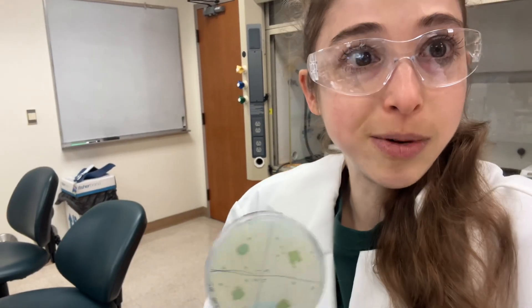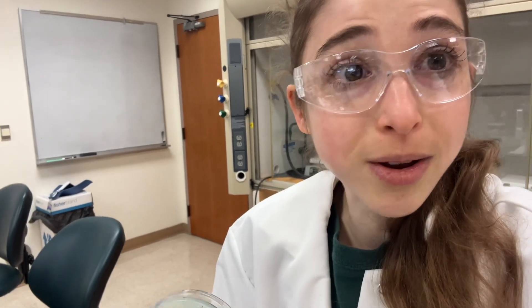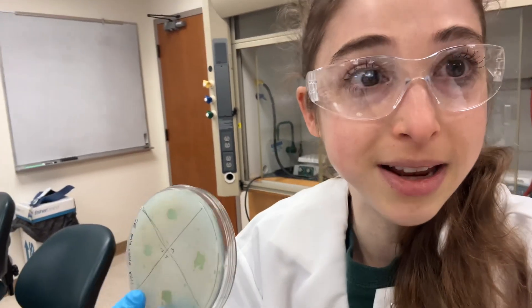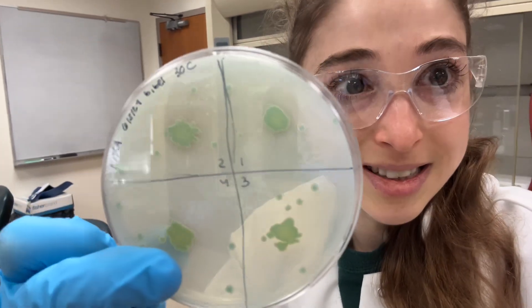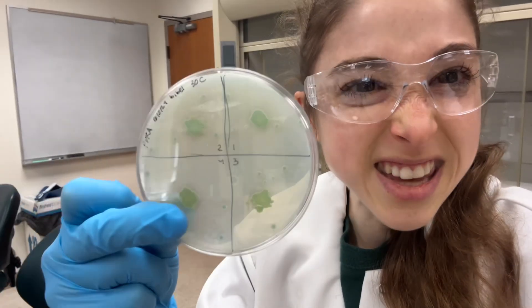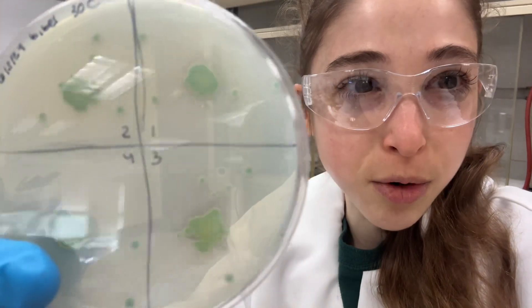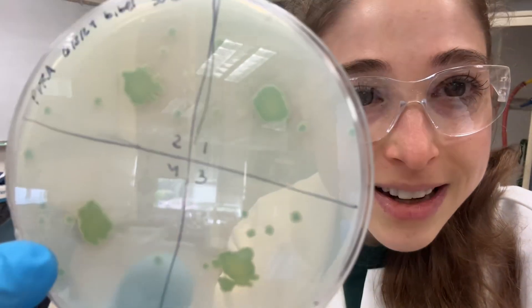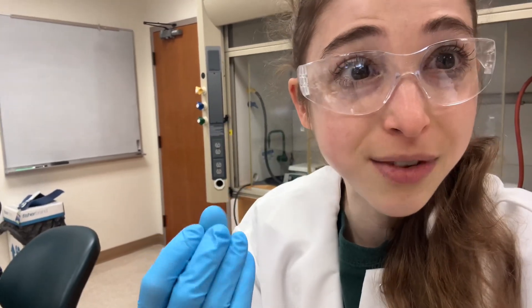We want to see whether the bacteria we're interested in can actually do that, because if they can, they free up phosphate in the soil for themselves as well as for the plants around them, which makes them really useful. You get that clearing zone here — the cloudiness is from that insoluble calcium phosphate, but the bacteria secrete organic acids which acidify the media, turning it yellowish and clearing that zone. The pH indicator helps you see it, but it's really that clearing that matters — that means they're solubilizing the phosphate and making it accessible.